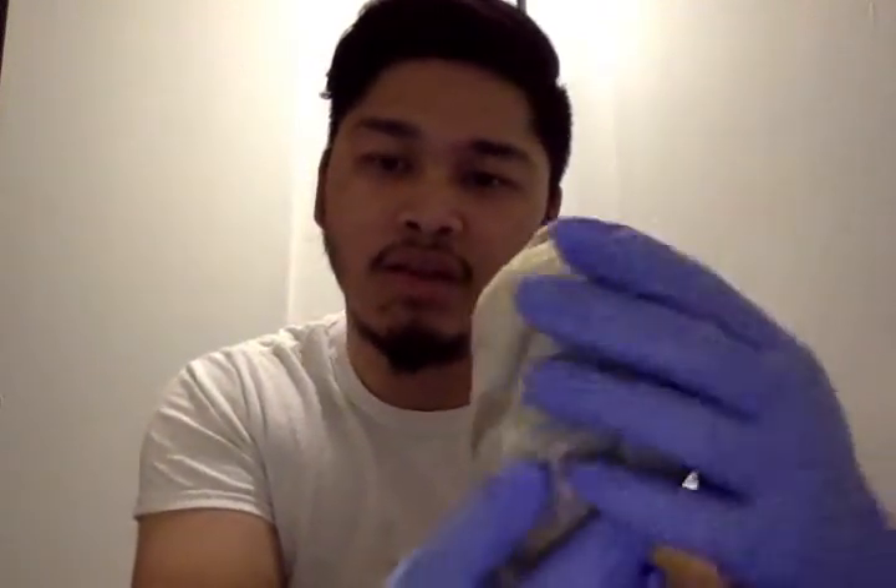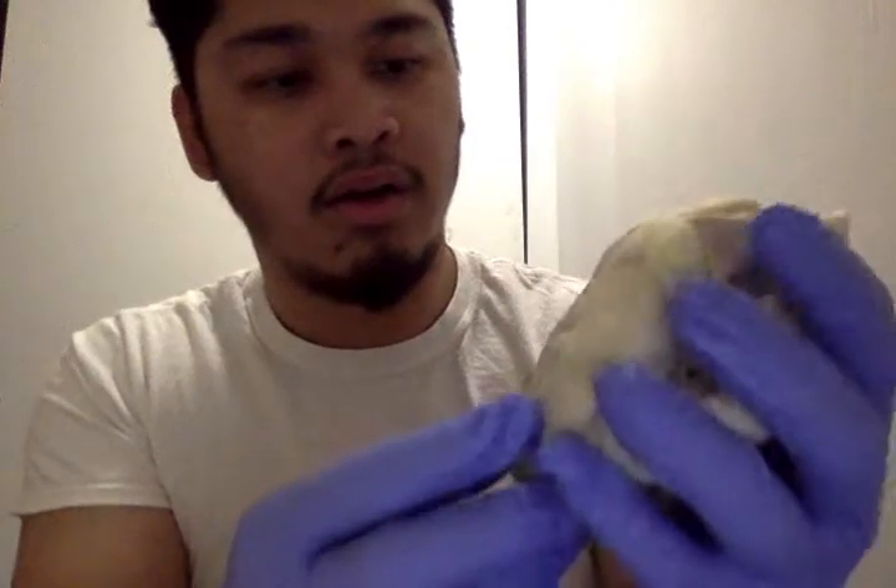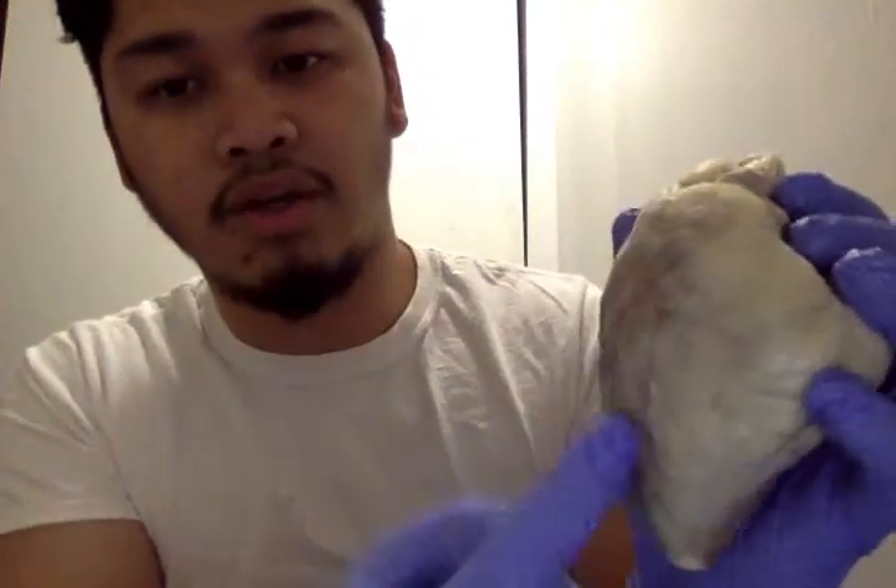So that's the anterior part and this is the posterior part, but this one doesn't have an aorta anymore. When I got this it was already cut, so it's open over here. This is the anterior part and this is the posterior part, and the anterior interventricular sulcus should be somewhere over here.